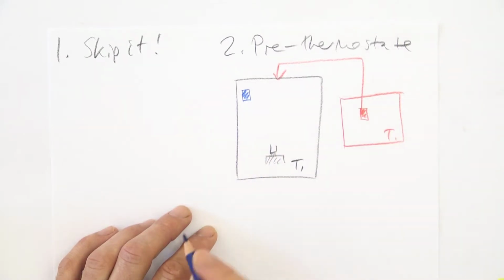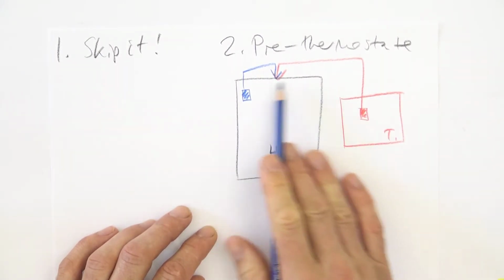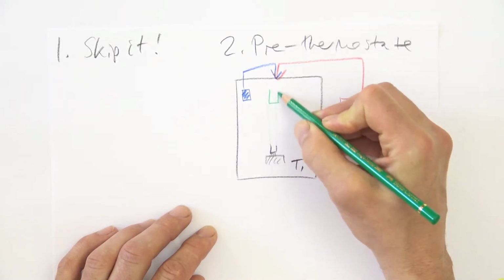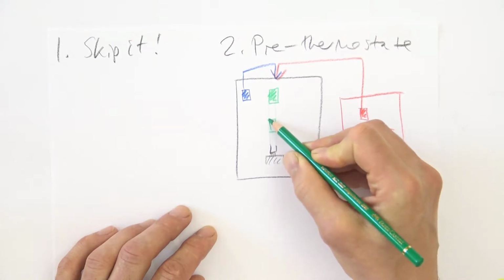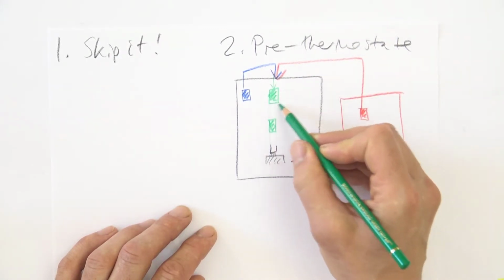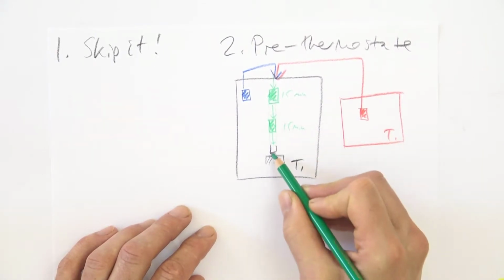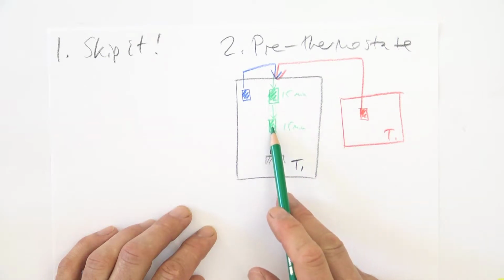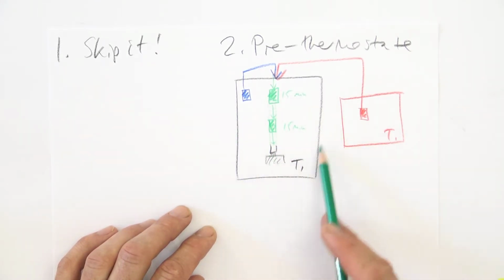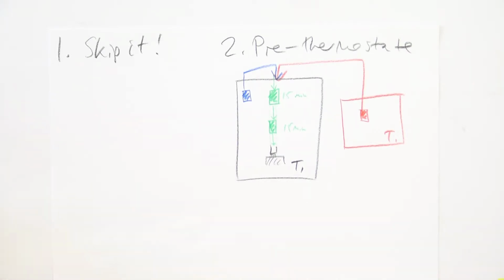The second way is, of course, to use the thermostat of the calorimeter as a pre-thermostat. This is possible in some calorimeters, not in all calorimeters. And the third way is what is commonly done in microcalorimeters. That is to have 2 pre-thermostating steps or equilibration steps in the calorimeter. So you first charge your sample to a position in the thermostat and leave it there for, let's say, 15 minutes. Then continue down for another 15 minutes and then go down into the measurement position. At every position here, the sample will equilibrate to the temperature of the calorimeter, and when it finally goes down to the calorimeter, the disturbance will be very small. So these are different ways to pre-thermostate your sample.